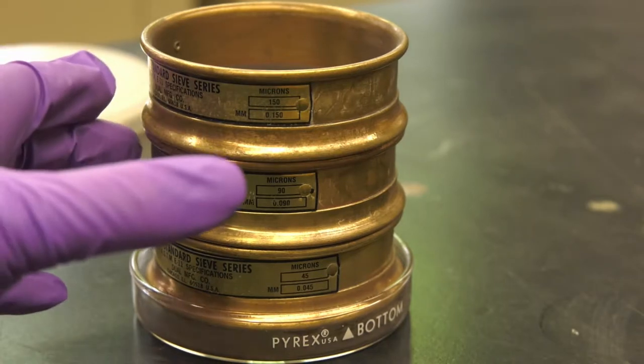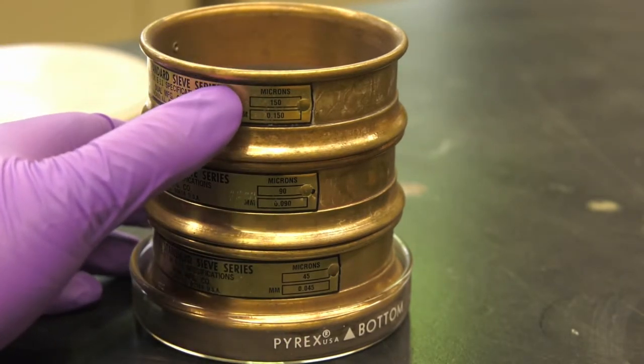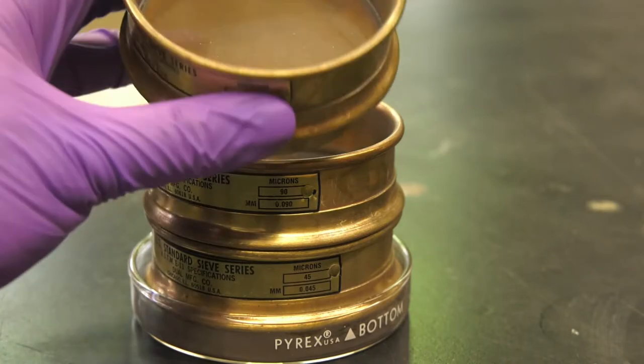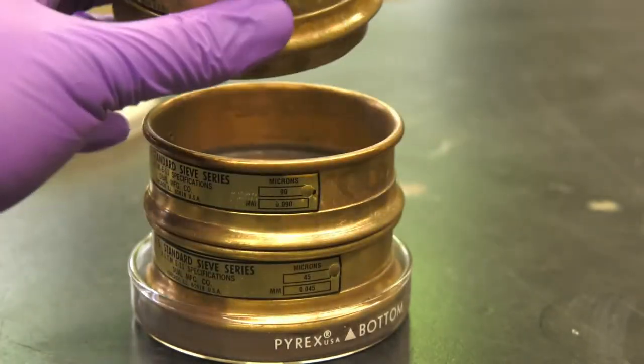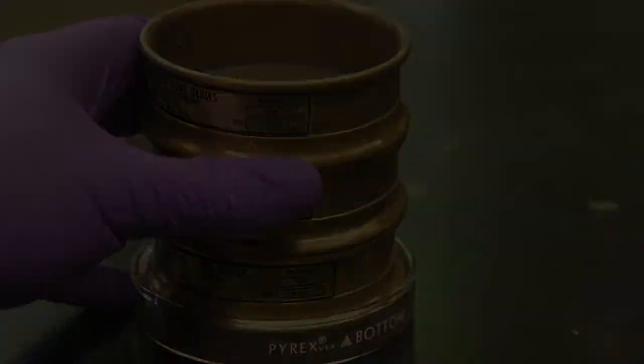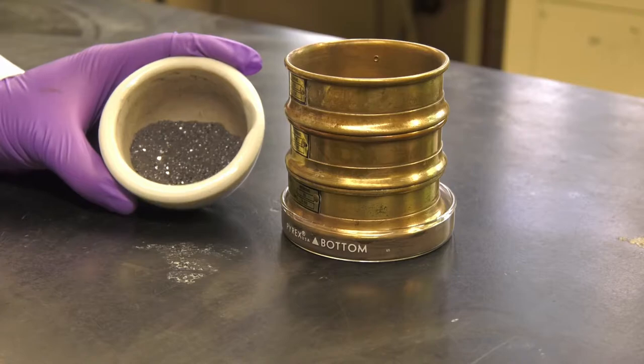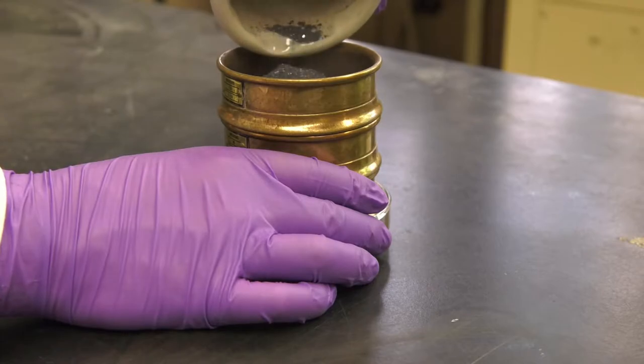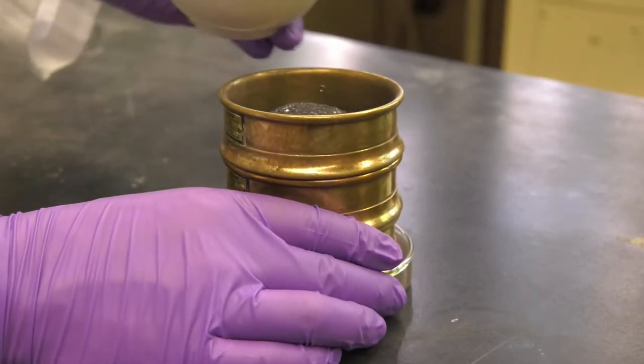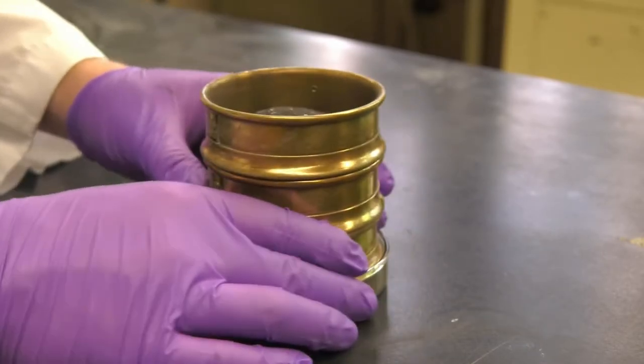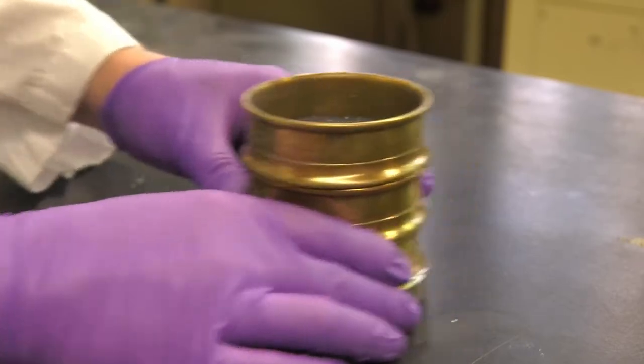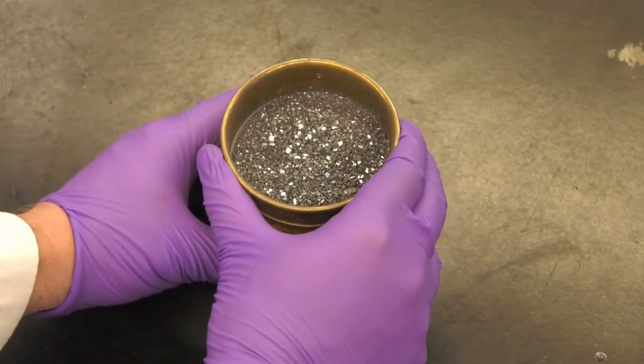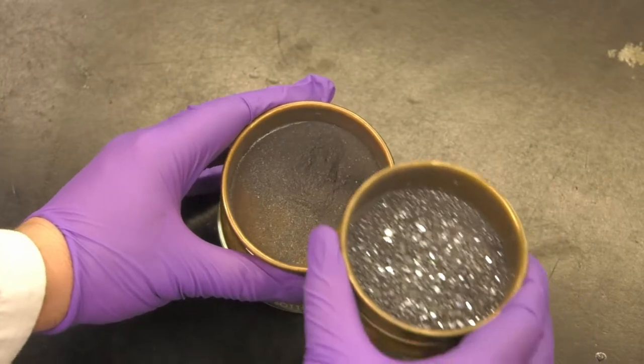The silicon powder is ready to be separated using three sieves with mesh sizes of 150 micrometers, 90 micrometers, and 45 micrometers. The mesh size refers to the opening created by the wire mesh. The silicon powder is added to the top sieve with largest mesh size and is shook back and forth. After some time, silicon powder will accumulate in different levels pertaining to their particle size.